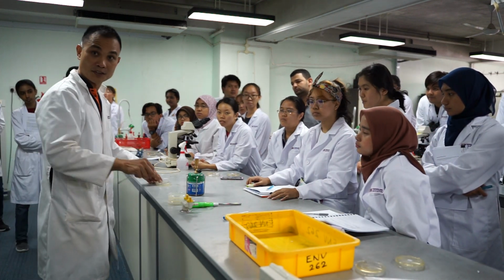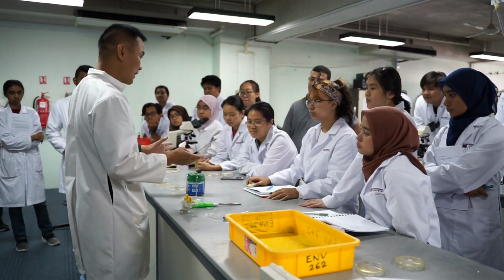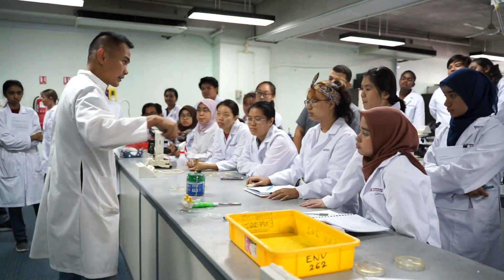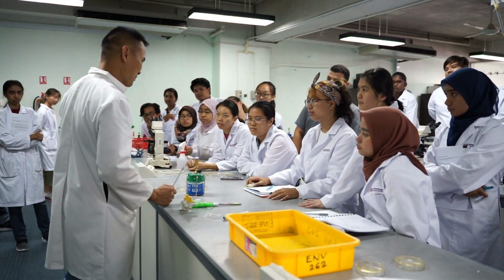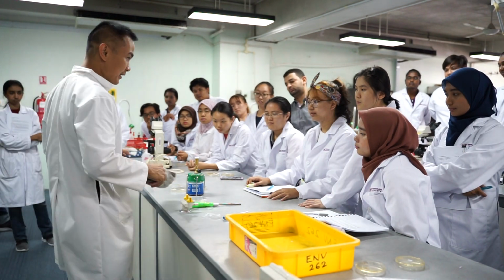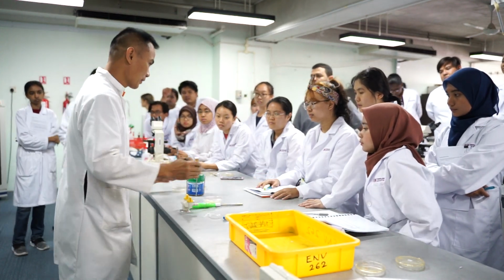Okay, so how do we do that? Thank you, Ponaida. We have this plate. We're gonna open it first. Okay, remember, the flame always needs to be as strong as possible, because it's basically sterilizing the whole area here. So if the flame is weak, bacteria is gonna go. And of course, do not talk like the way I do, because the bacteria from my mouth is gonna go into here. So first thing you need to do is spray the whole thing down there with alcohol, and then clean it like we did before. And then if the flame is strong, you're gonna sterilize the whole area here.